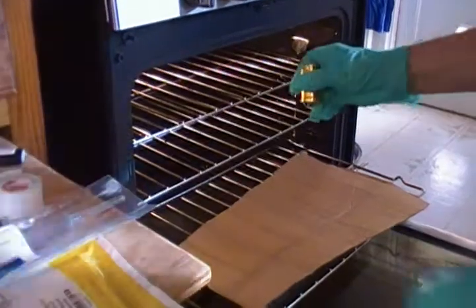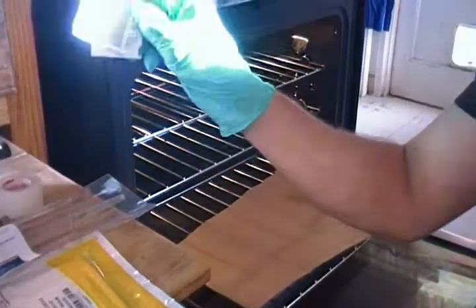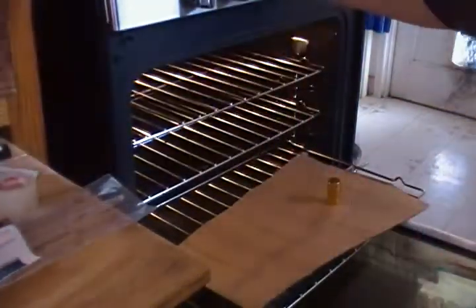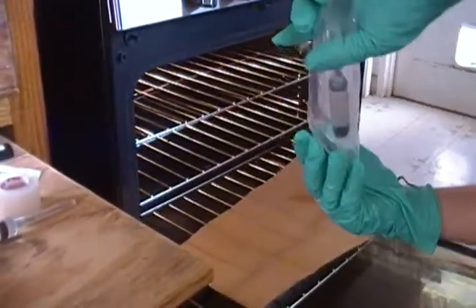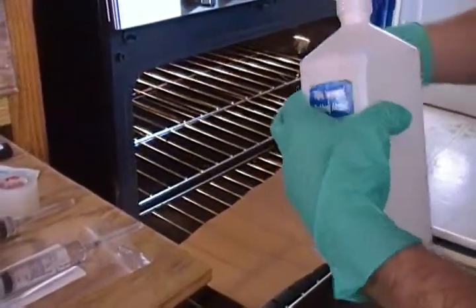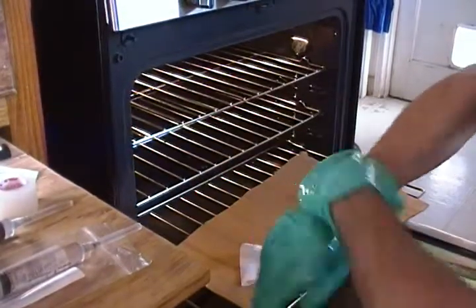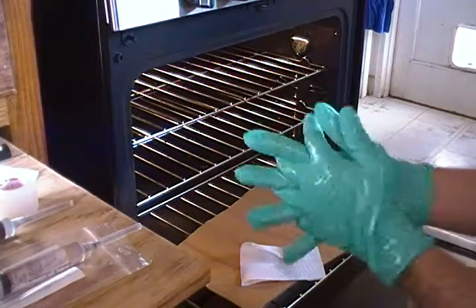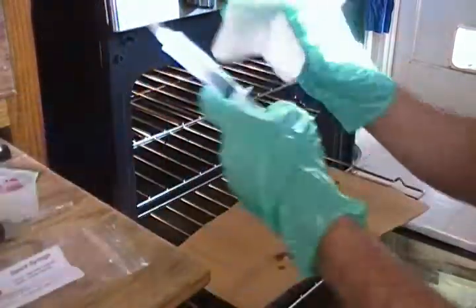I have my alcohol beaker right here, alcohol wipes, and surgical gloves — I normally use surgical gloves since they're for surgeons. First, saturate your gloves with alcohol and rub it on and in between the fingers, because things hide there. You can also use Purell. Then we're going to sanitize the outside of the syringe really well.